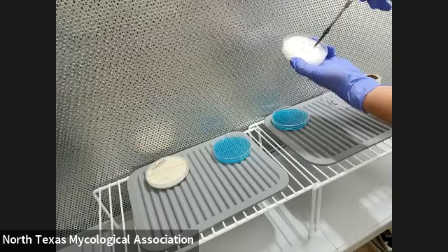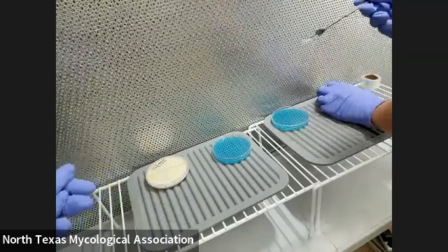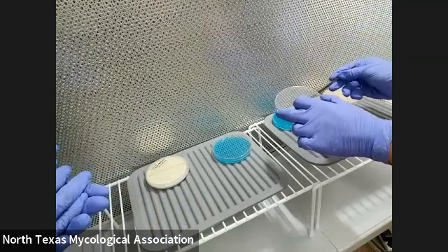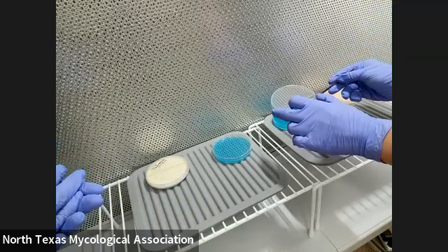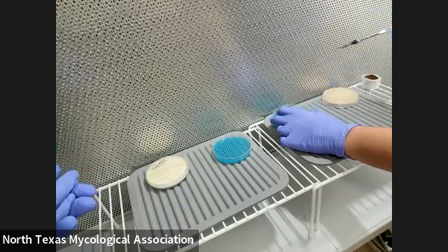We've got a triangle — a square. I'm just going to pick it up like that. So now it's on your scalpel. And then I'm just going to put it on the plate like that. And then that's done.